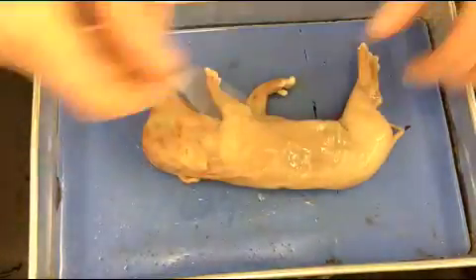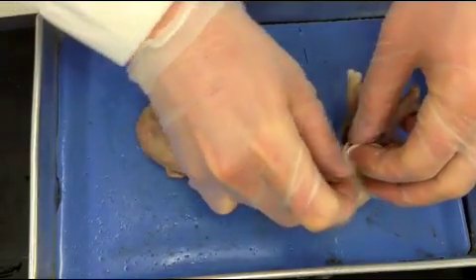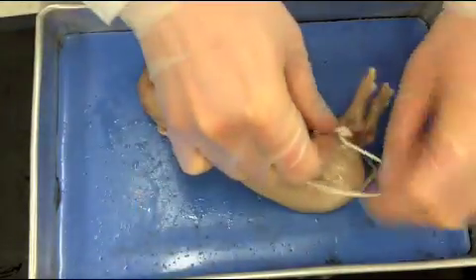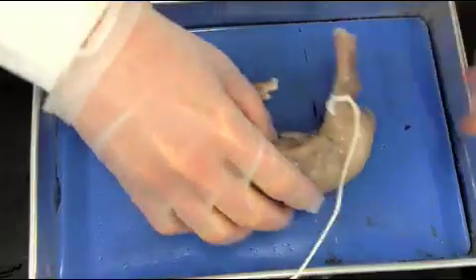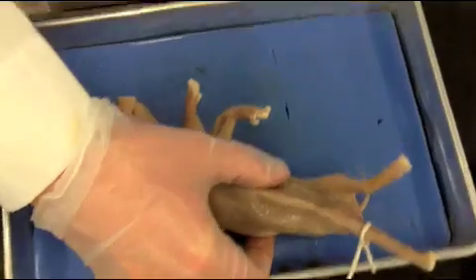The first thing I'm going to do is start with the hind legs. I'm going to tie a piece of string around the back leg — it doesn't have to be super tight. I'll double knot it just to make sure that it stays on. Then I'm going to wrap that string around the underneath portion of the dissecting tray.